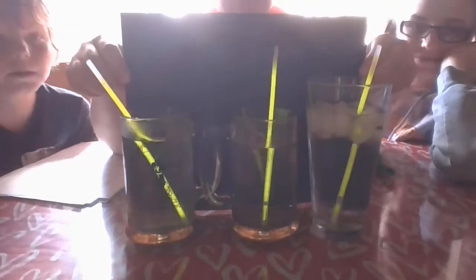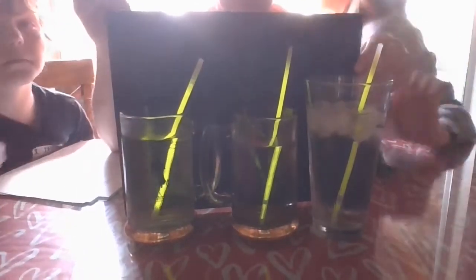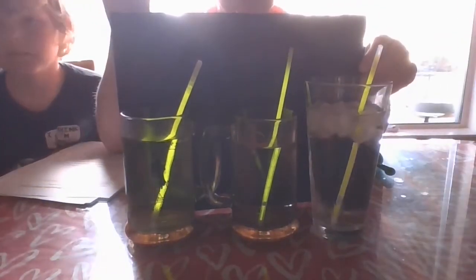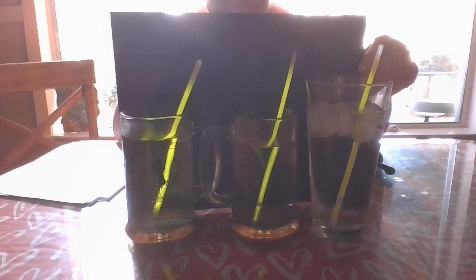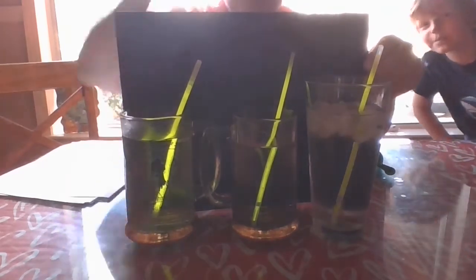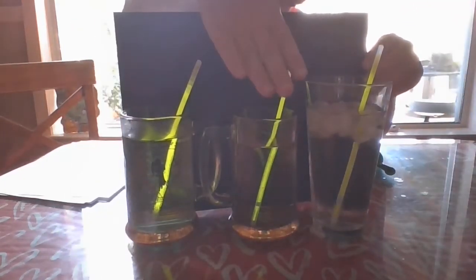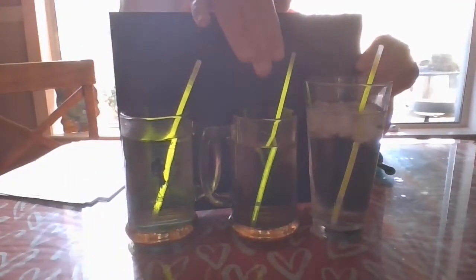There we go. We're going to watch these for a minute as they're in hot, warm, and cold. You can start seeing what's happening to the chemical reaction, or how bright these are. You should be making your observations in the observations during box for hot, warm, cold.